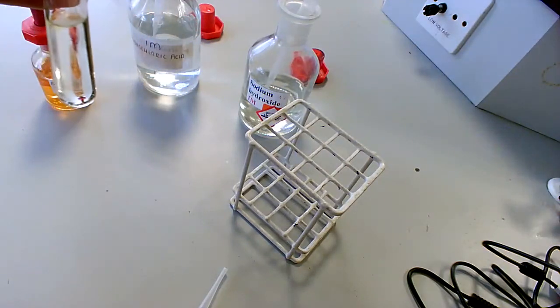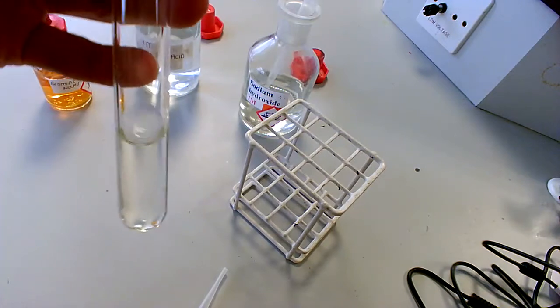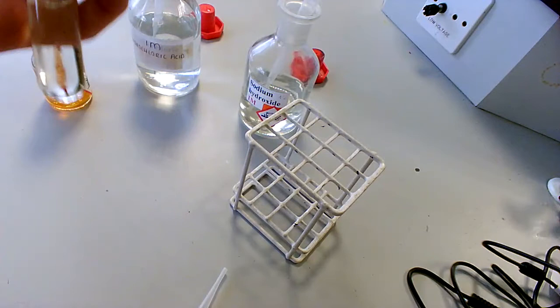So as you can see, the color has changed from orange to colorless, absolutely no color.